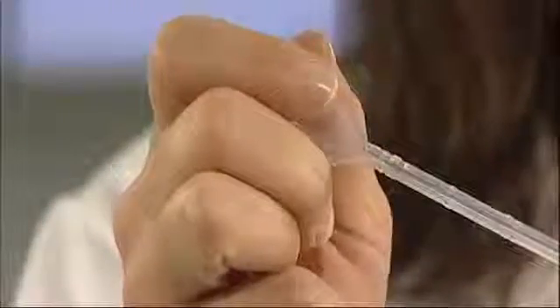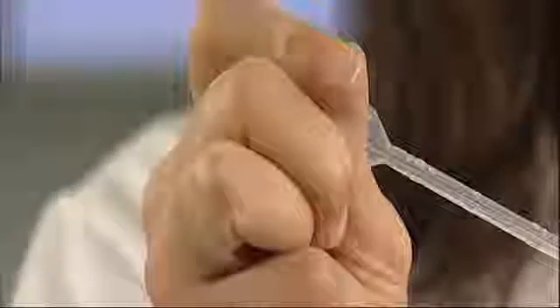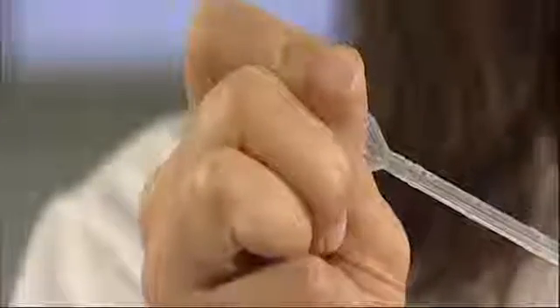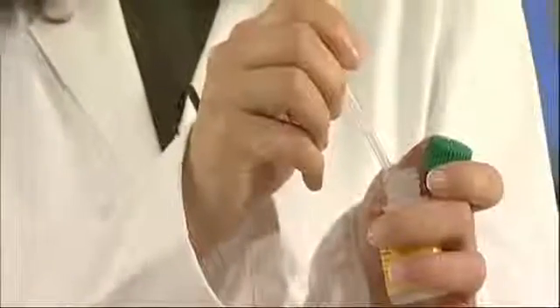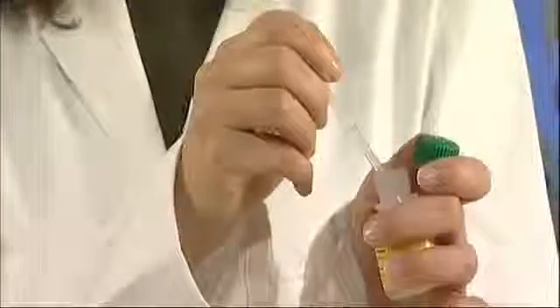Ampicillin and arabinose are rehydrated in transformation solution. To avoid bubbles, it's a good idea to squeeze the bulb of the pipette first before entering the liquid. Gently release the bulb of the pipette until the liquid hits the 1 ml mark on the pipette.